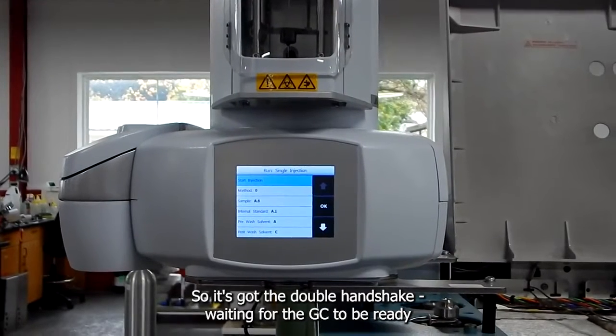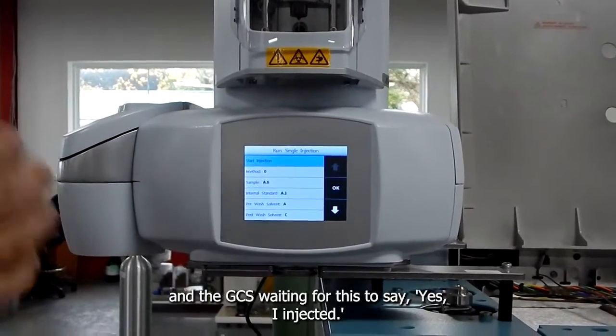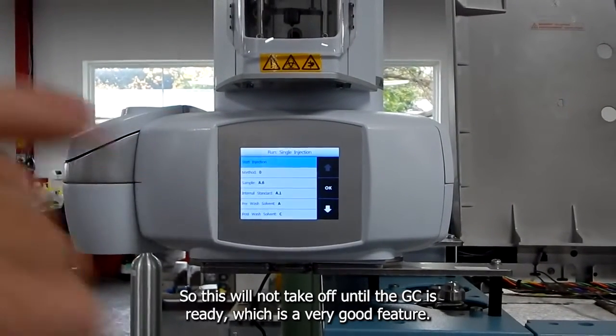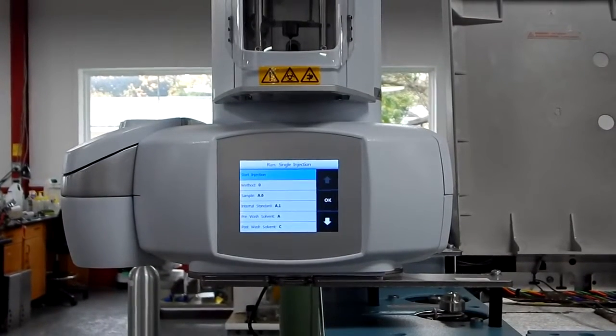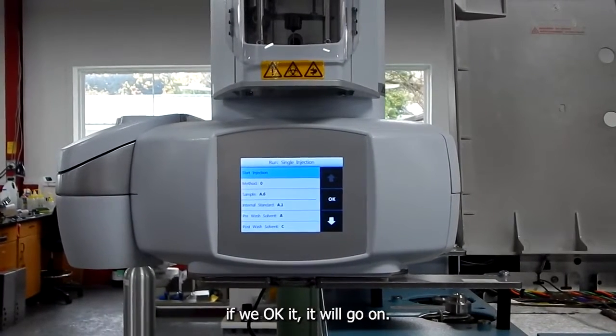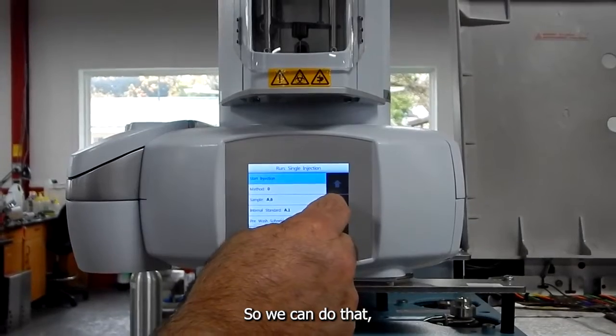So it's got the double handshake. It's waiting for the GC to be ready, and the GC is waiting for this to say yes, I injected. So this will not take off until the GC is ready, which is a very good feature. So in this particular case, if we hit OK, it will go on. So we can do that.